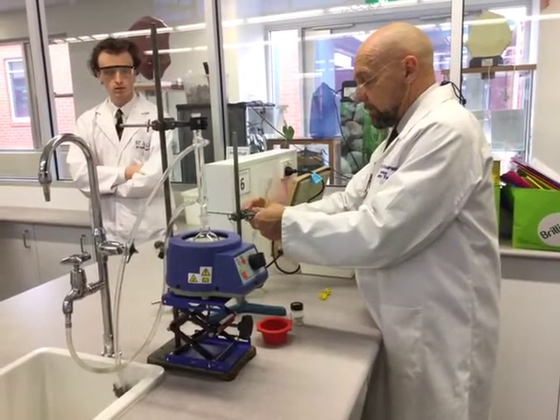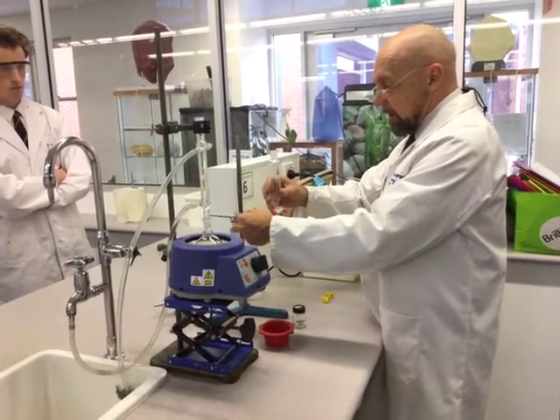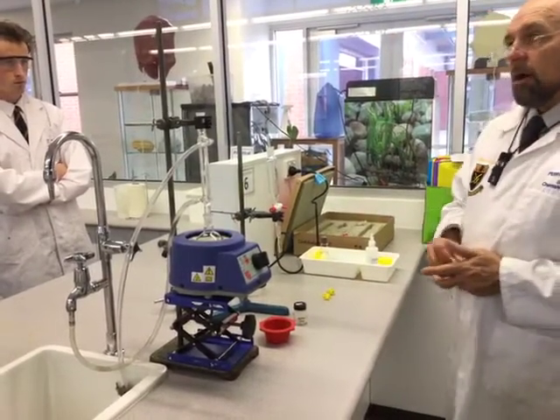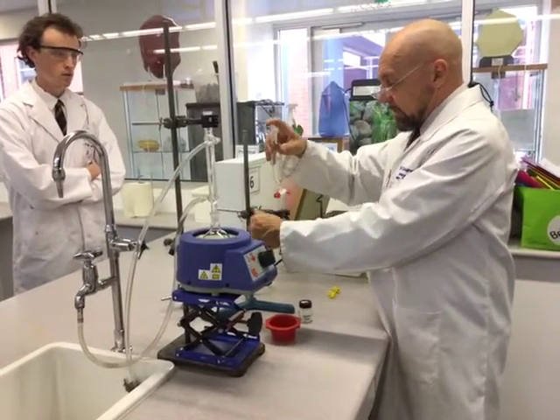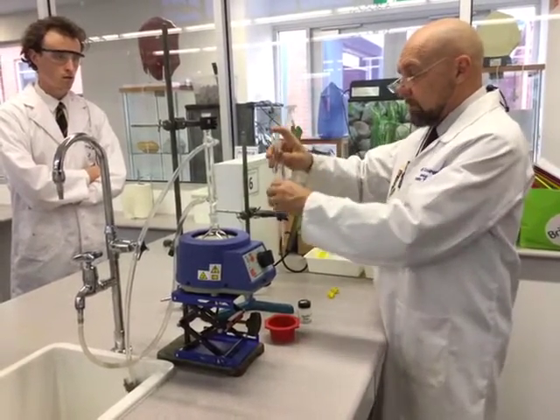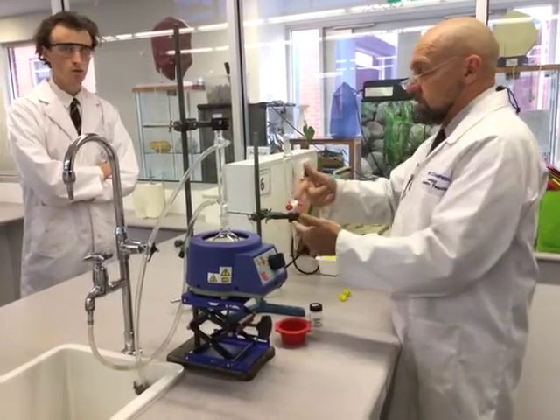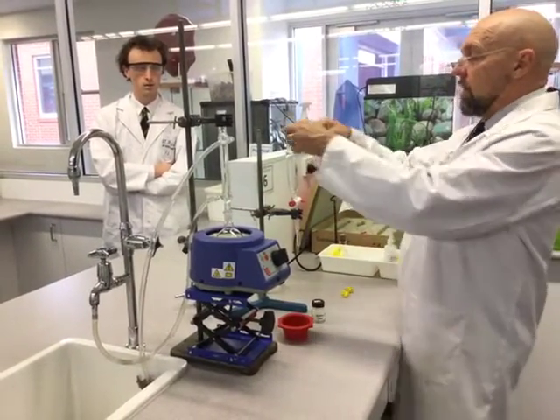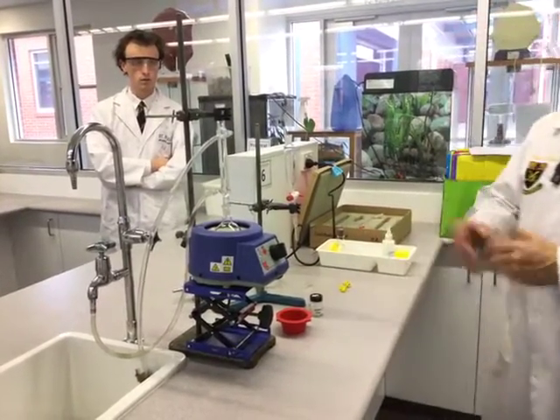For the extraction process, I'd suggest you have a few clamps set up to support the separating funnel. I'll take you through the separating process later. We're going to decant all of our chemicals from the round bottom flask — minus the boiling chips, because they'd block the tap — using a filter funnel, straight into our separating funnel after we've done our reflux.